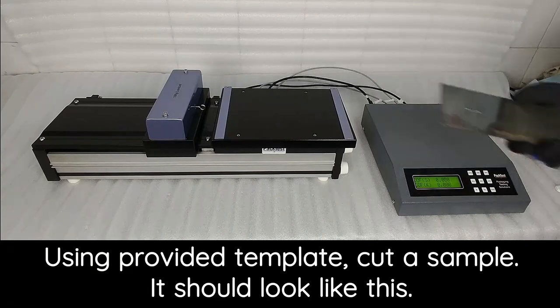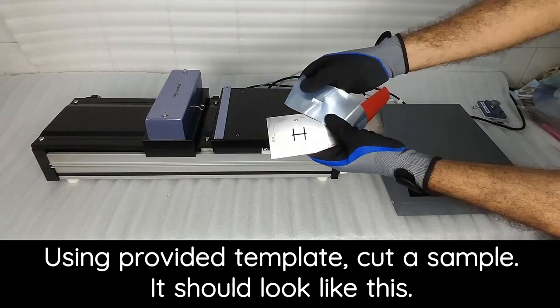Using provided template, cut the sample. It should look like this.